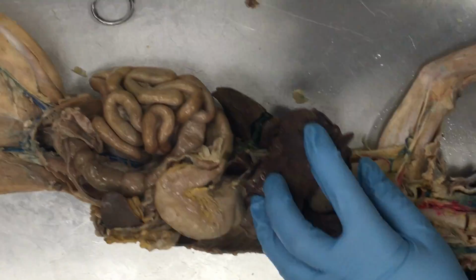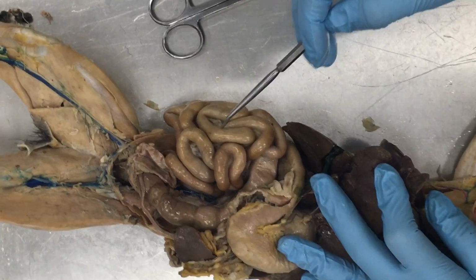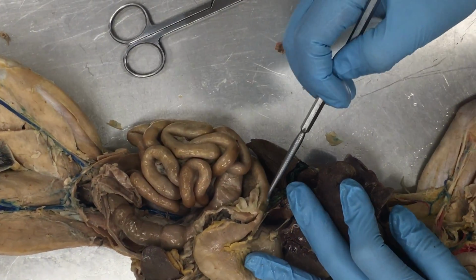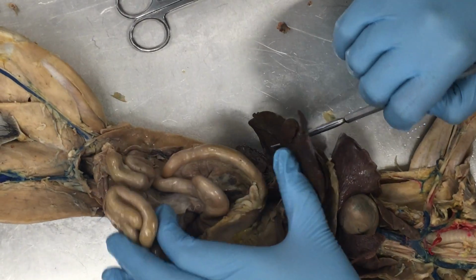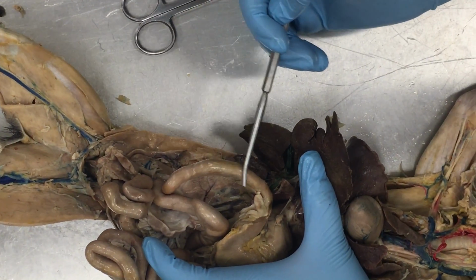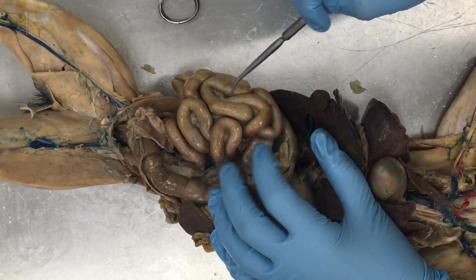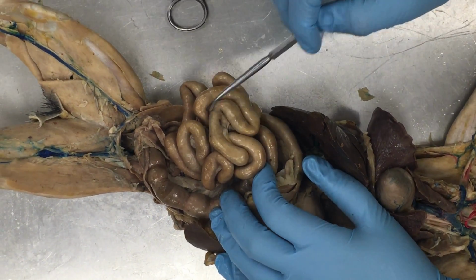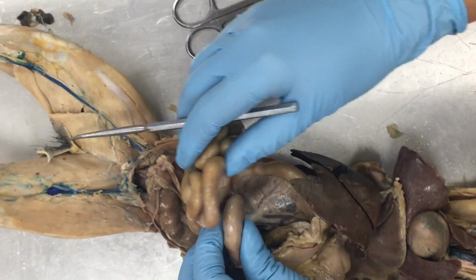All right. From there, we've now entered into the small intestine. The small intestine is all of this thinner, really sort of tangled up tubing. The first portion of the small intestine is specifically the duodenum. It is this much sort of straighter portion of the small intestine. From the duodenum, then we go into just sort of all of this tangled mess. This is our jejunum, and then finally our ileum. Our ileum is our end portion.